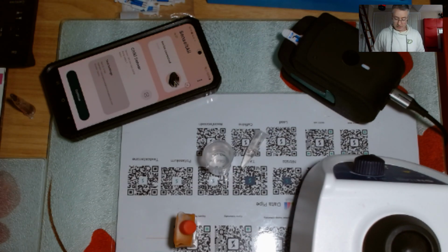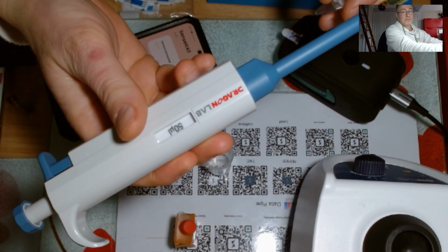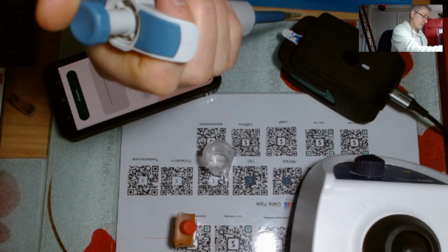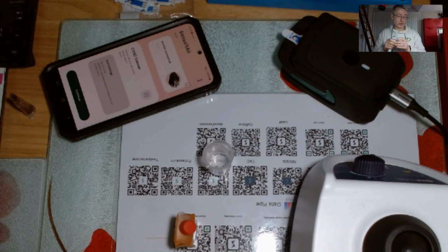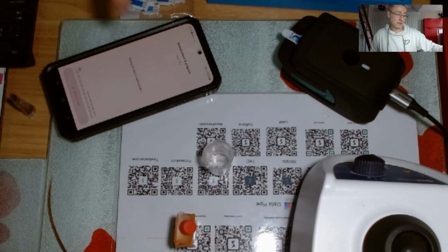Now what I'm going to do is get a clean pipette tip. I'll take 50 microliters of this. I'll continue. Now I'm going to very carefully make sure I choose 100 because I have gone to a 1 in 100 dilution, which I've now chosen 100. I'll go start measurement, and off it goes.